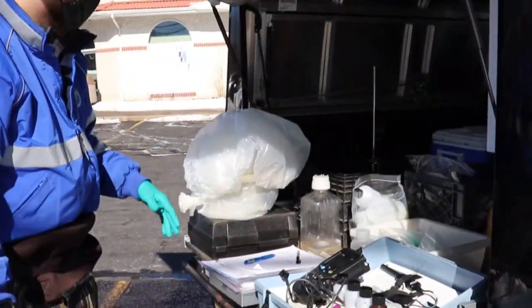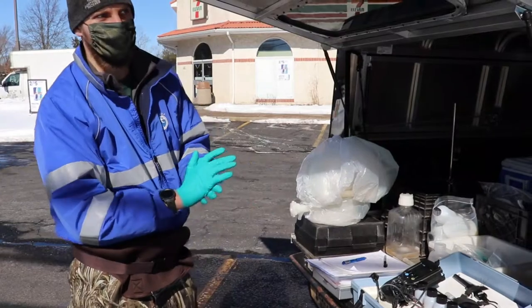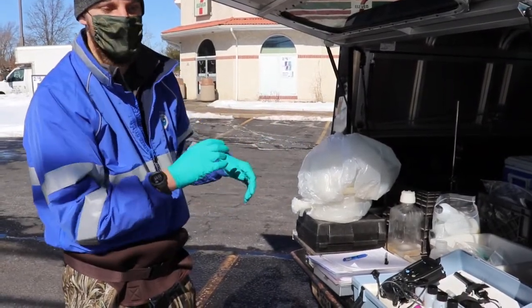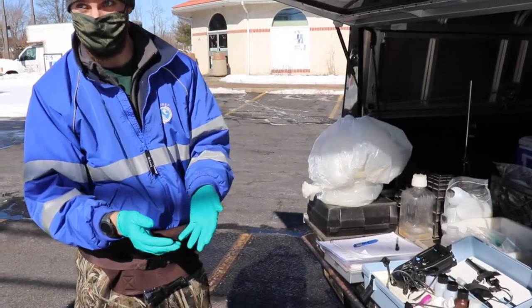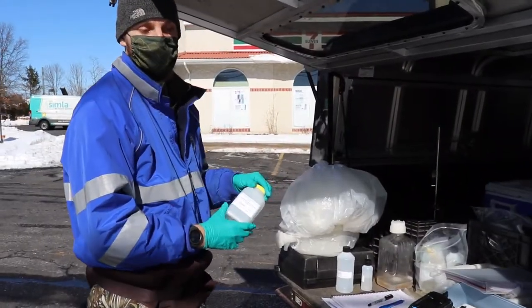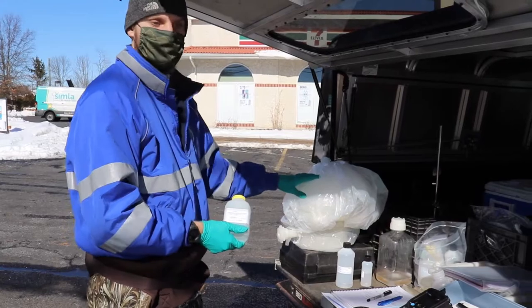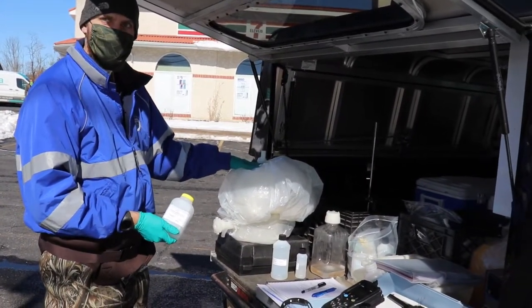Before we do that, we're going to collect some samples. These are what are going to be called our total parameters — the ones that are going to be suspended in the stream column, as opposed to being dissolved. So we're ready to take our total samples here. Total samples are going to be unfiltered, straight from the churn — the technical name of this is a churn splitter.